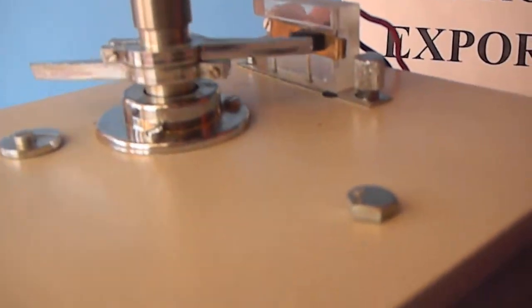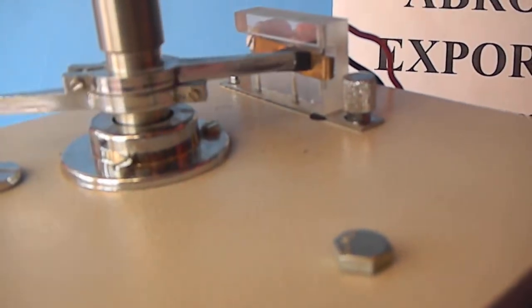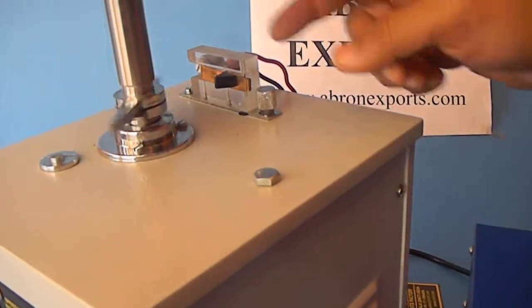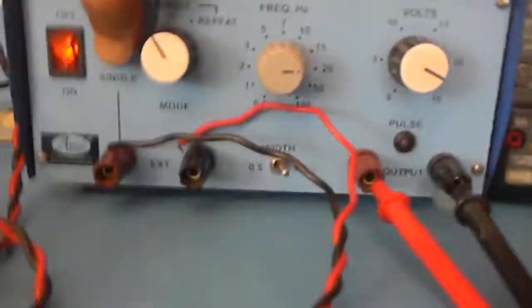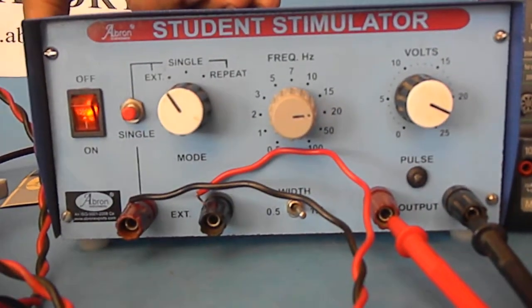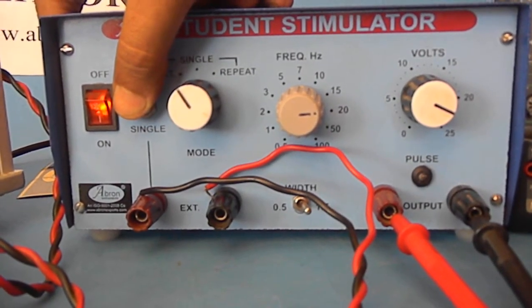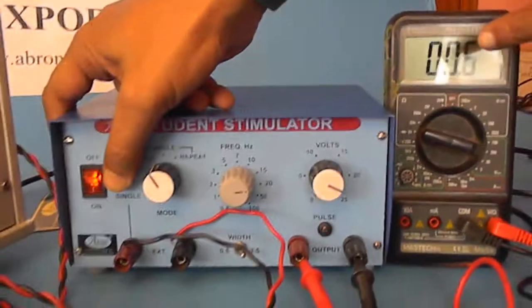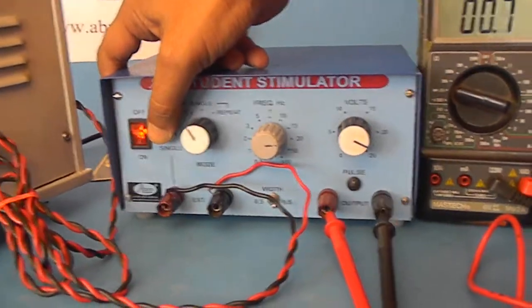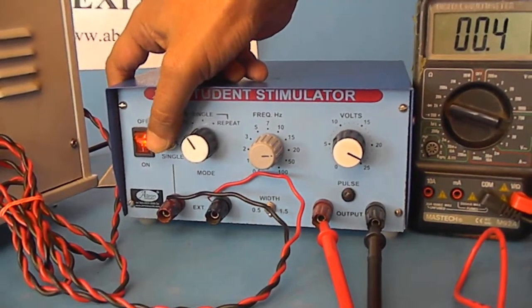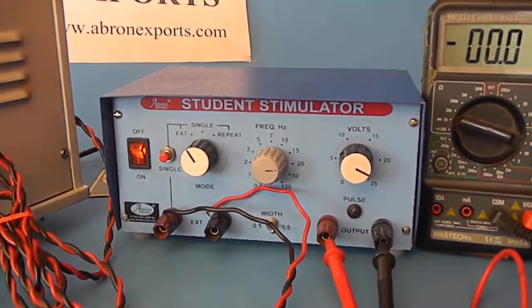Now this is working, first, second. The pulse will be going to the muscle. If you leave it, no pulse will go. Press it, you can see the pulse is going. Thank you very much.